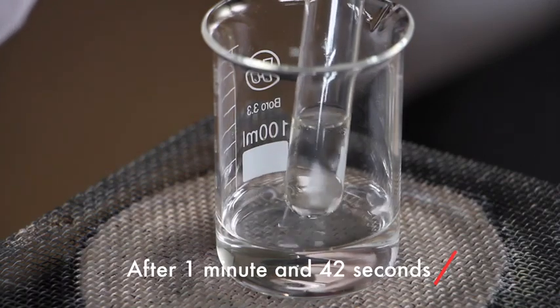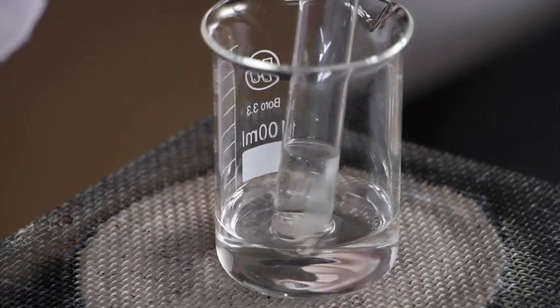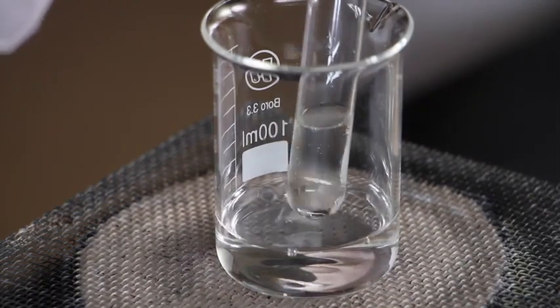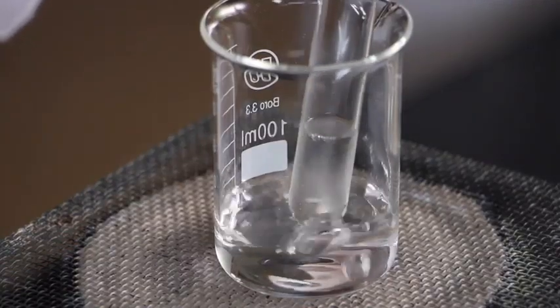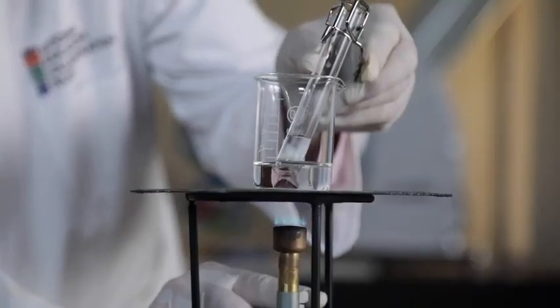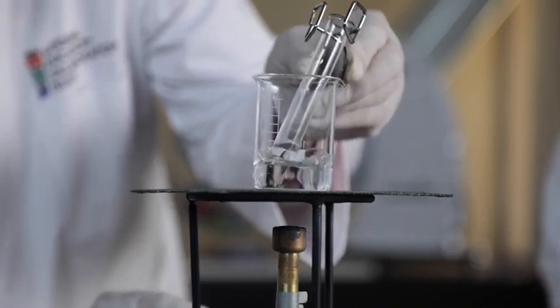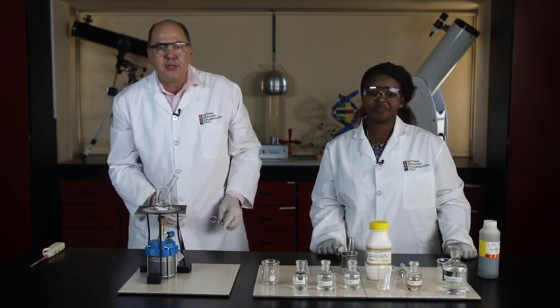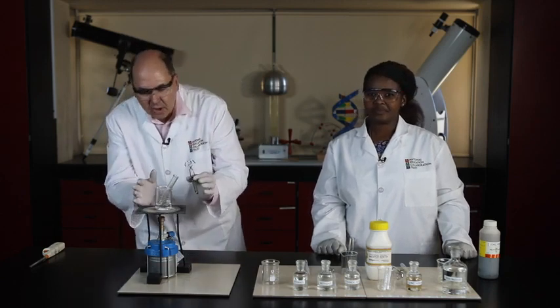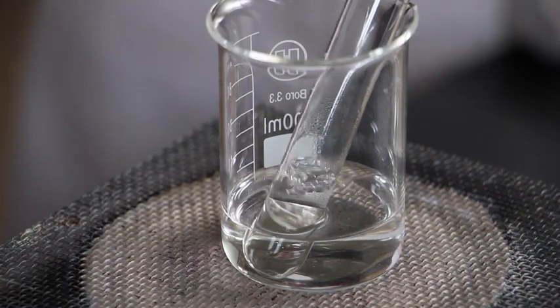We're getting some bubbles inside the reaction vessel. And the water looks like it's almost boiling. There we go. Water's boiling. I'm turning off the Bunsen flame. I'm going to let it cool down for a minute while it stands on the gauze mat here. The reaction is going quite nicely.